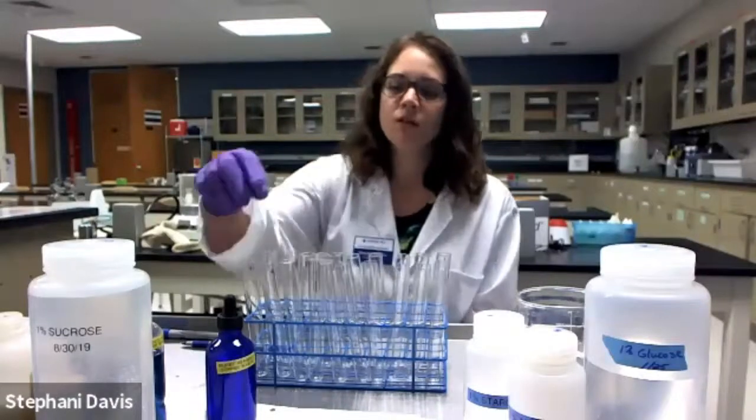Hello everyone. In this exercise, we're going to use different reagents to test for the presence of macromolecules. So I have two tests that we're going to start with. The Biuret reagent will test for the presence of proteins, and Benedict solution will test for the presence of simple sugars, which we can also refer to as monosaccharides or reducing sugars.